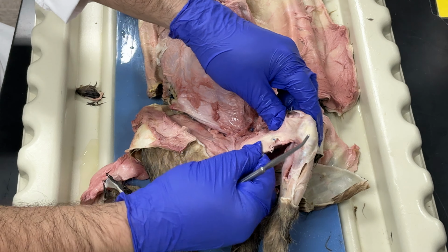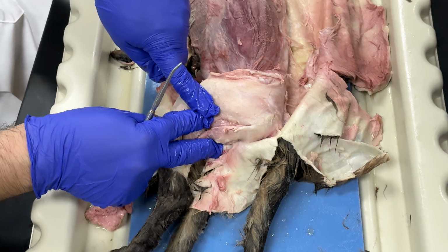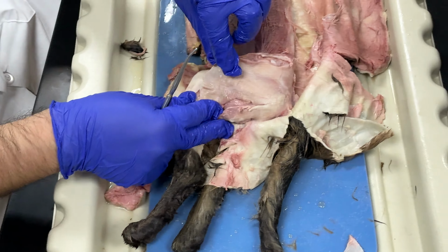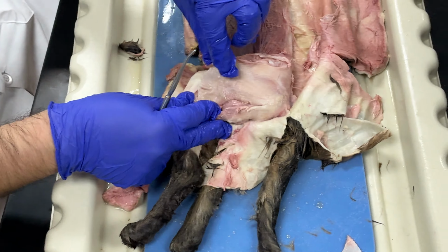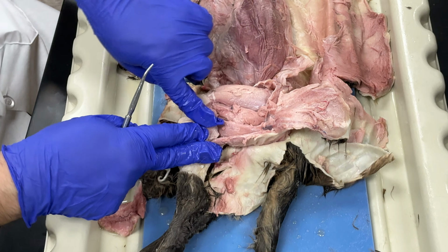And then a muscle that was here on the top. So this was the gracilis, and this muscle on the top, this is called the sartorius, right? So I had gracilis and sartorius on the inside. And then on the outside, I had the biceps femoris. So to look at muscles that are deeper, I cut away the sartorius, right? And I cut away the biceps femoris, and then I see some muscles.